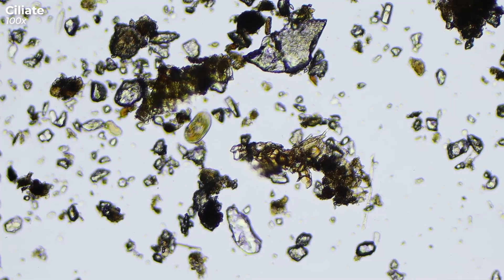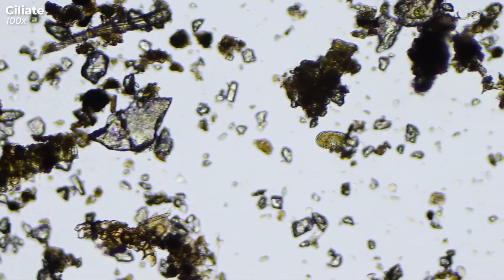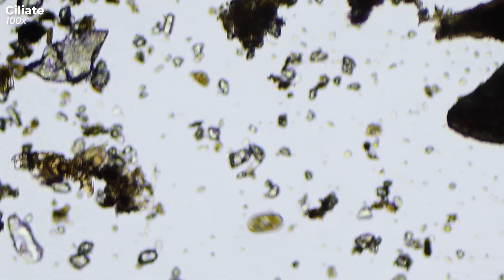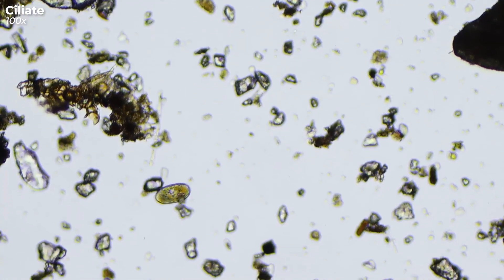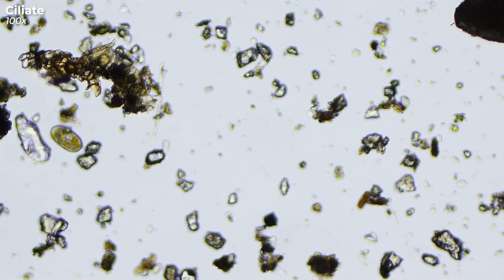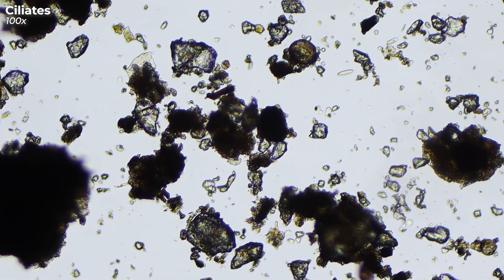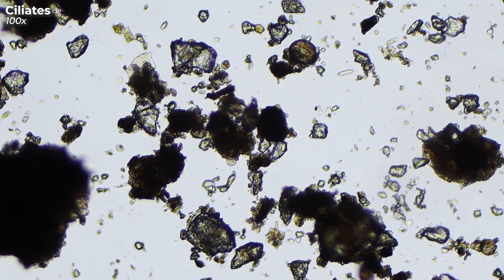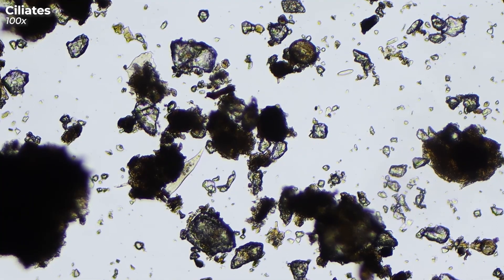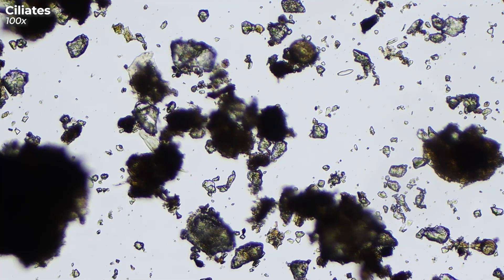Mosses are crucial for soil stabilization and water retention, helping to prevent flooding and landslides. They also serve as a food source and habitat for macro- and micro-organisms, like these little ciliates here.